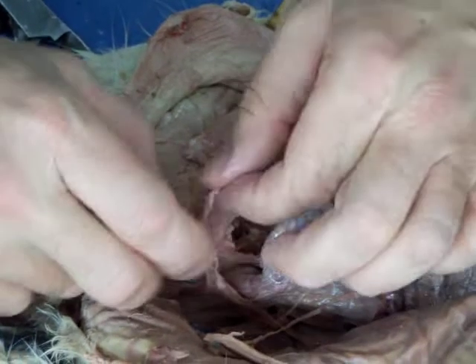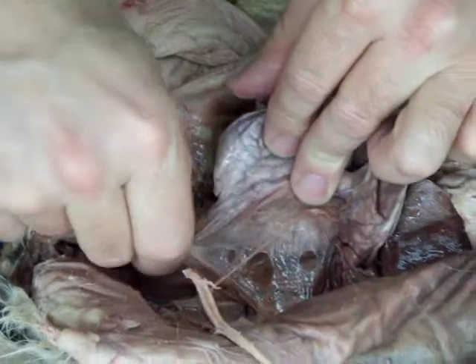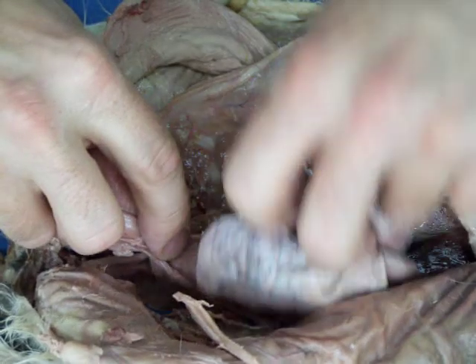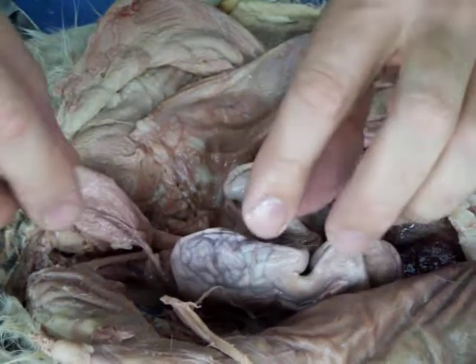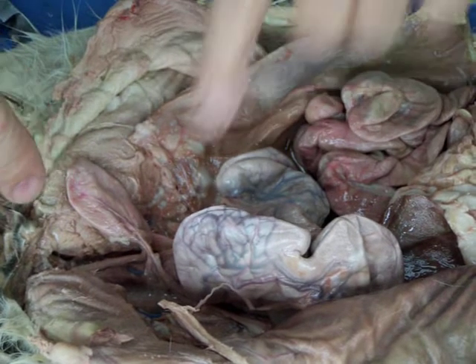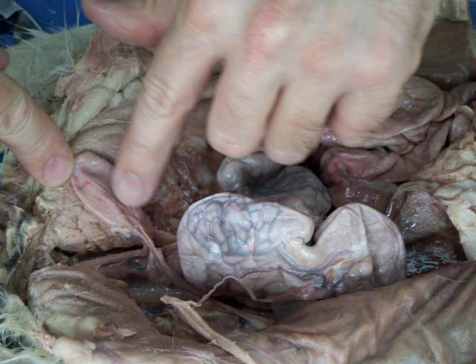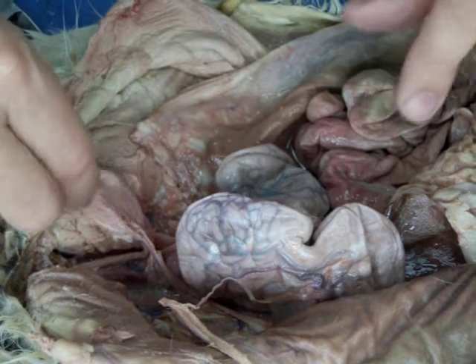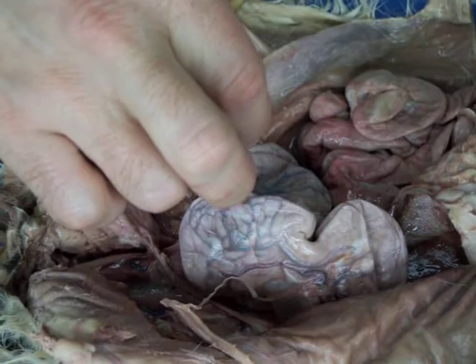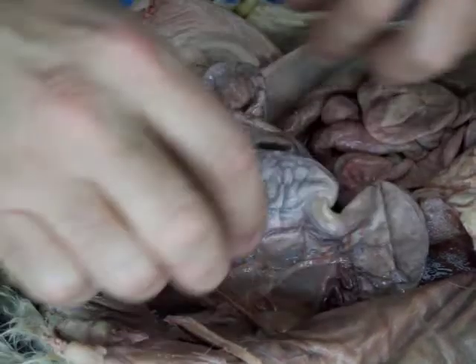and they have these 3 ligaments that hold the bladder intact. And then the vesical arteries, you can see here, the vesical veins run with those in the lateral ligaments. Now today, what I was talking about, those umbilical arteries, those you can see continuing up here. See this up here? That's the umbilical arteries, which will go up to the body wall, the belly wall, and go out to the umbilicus, the navel, in the embryo.